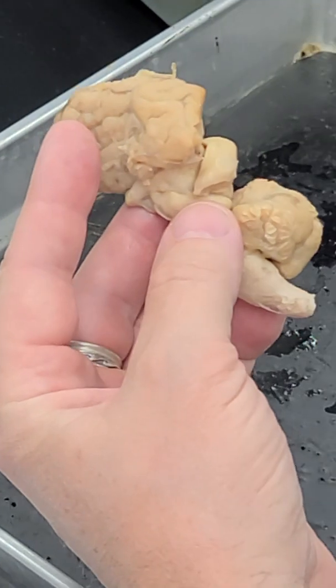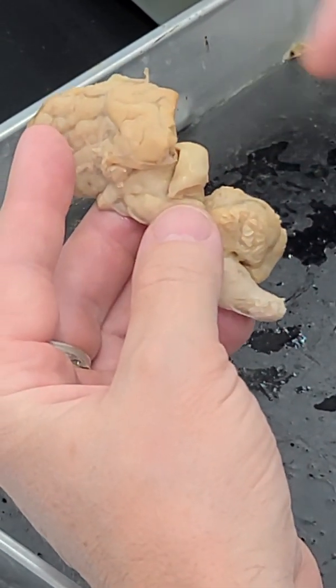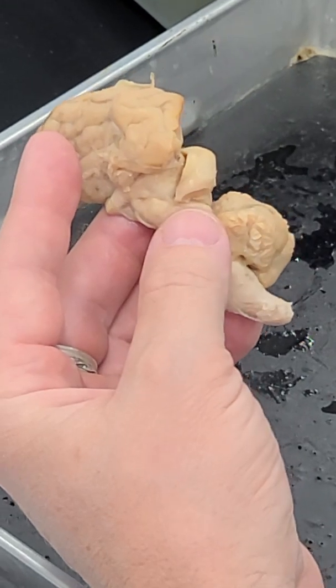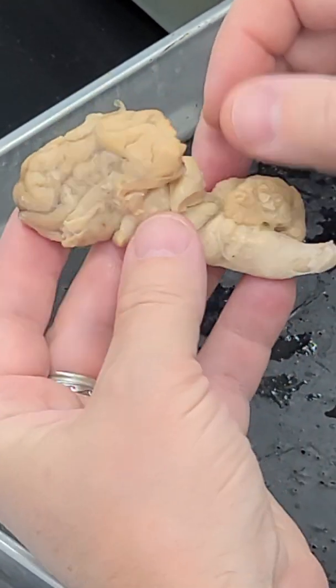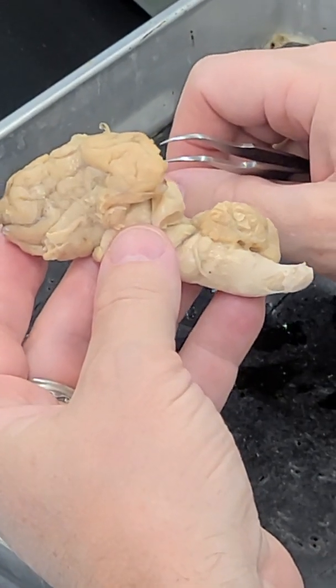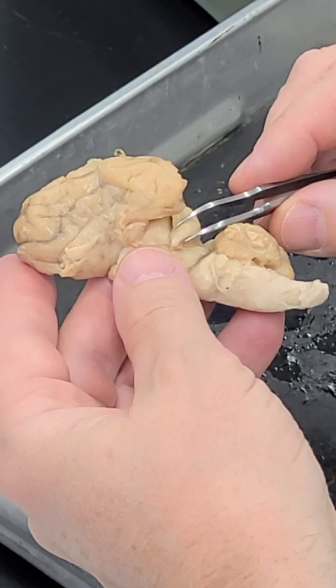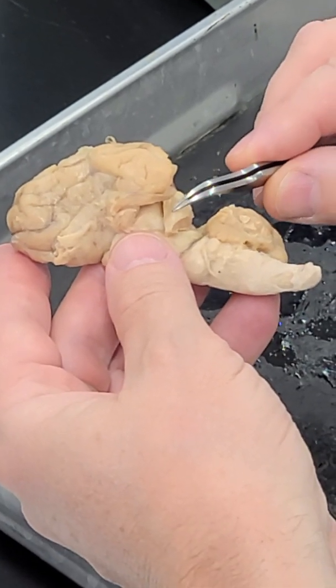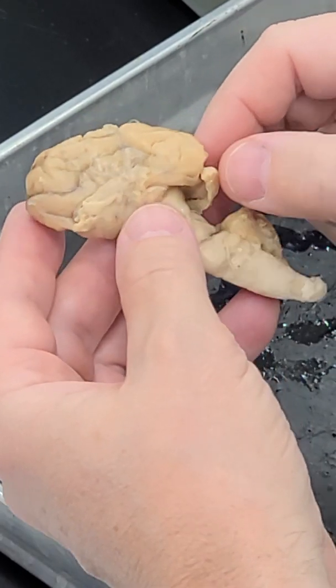So we often talk about the amygdala and the hippocampus together when we talk about the limbic system, when we talk about learning and memory, etc. So I thought the amygdala was like its own little bean-shaped thing, like a little lima bean. That's it. That's a little bean-shaped thing, swelling right here. Okay, little lima bean.